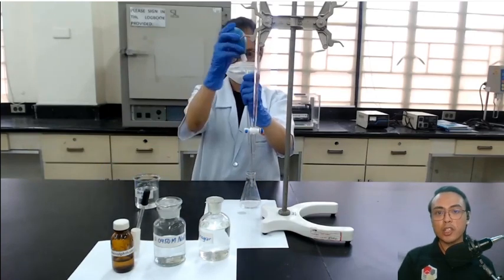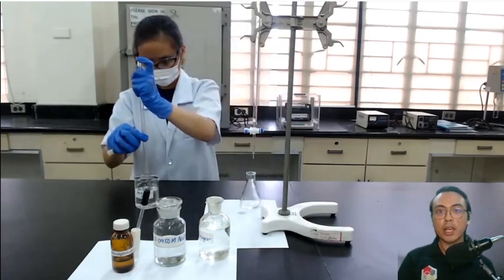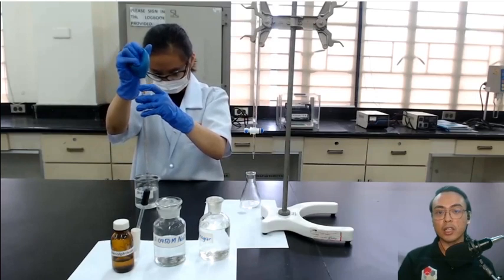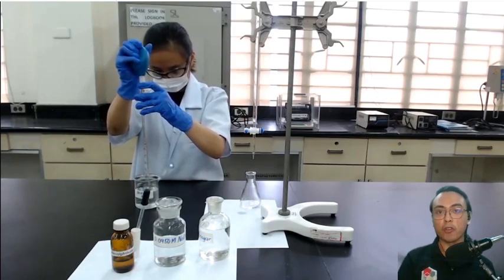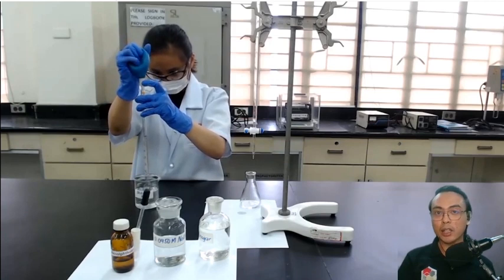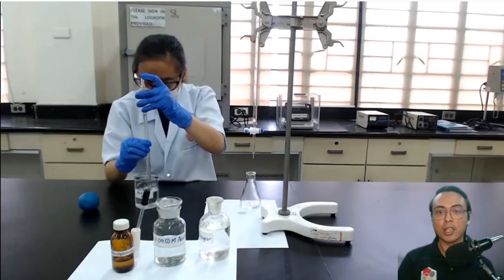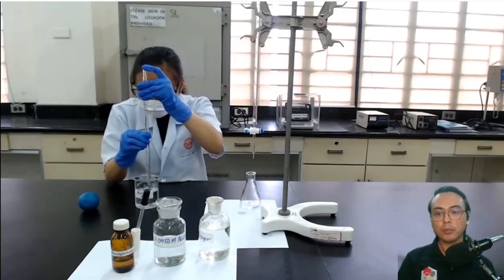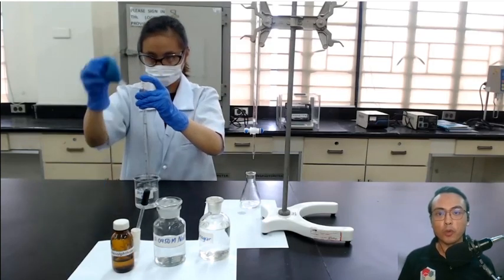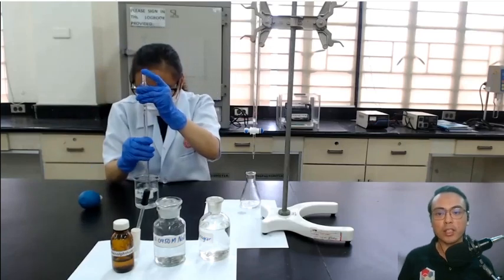Notice that she is also washing the sides of the Erlenmeyer flask, just in case some droplets of vinegar have adhered to the sides. That ensures that when you titrate later you react all of the acetic acid in your sample. Let's wait for her to finish adding the required amount of distilled water to the Erlenmeyer flask.